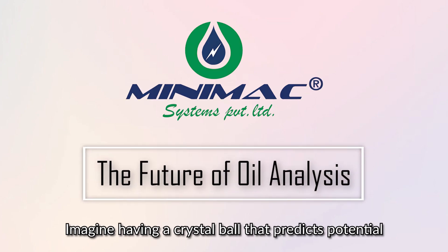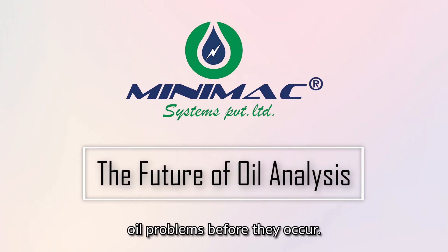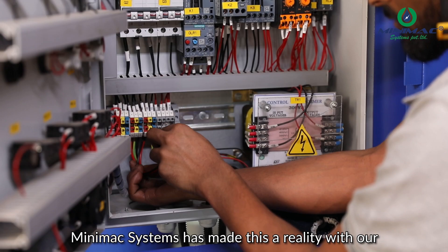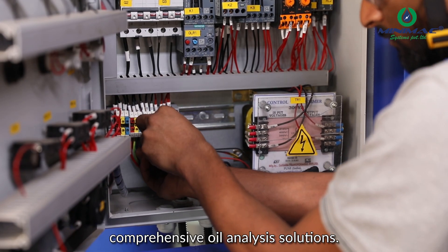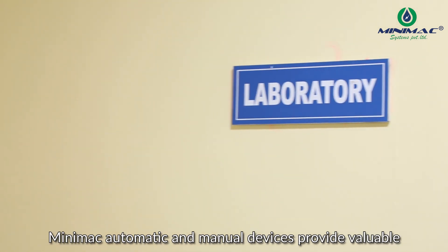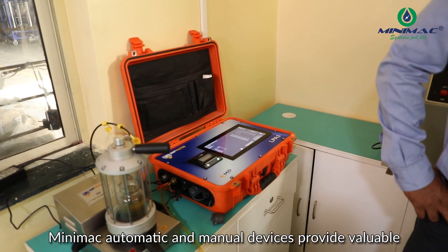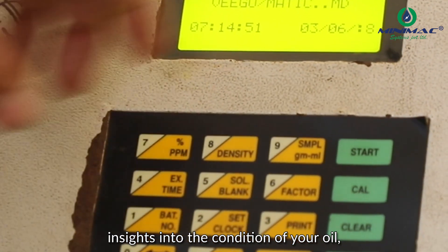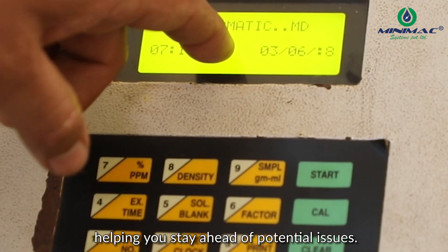Imagine having a crystal ball that predicts potential oil problems before they occur. Minimac Systems has made this a reality with our comprehensive oil analysis solutions. Minimac automatic and manual devices provide valuable insights into the condition of your oil, helping you stay ahead of potential issues.